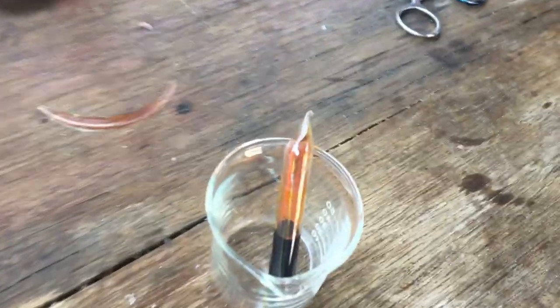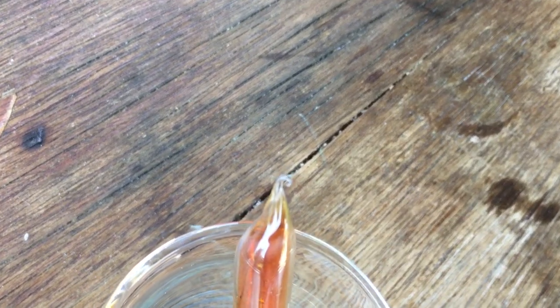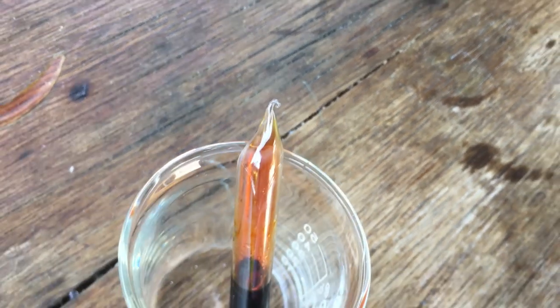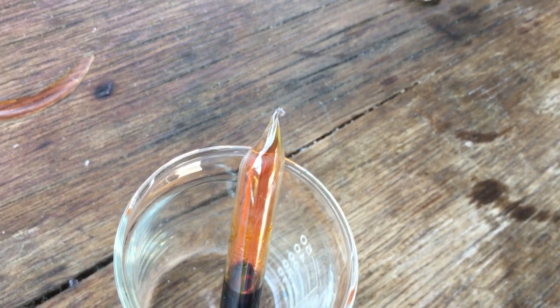Alright, that's the second attempt done, and looking at it, I mean it looks alright, better than last time. I can't get it to focus. There we are. Hopefully that is sealed, but we'll have to wait for it to cool down and then we'll check.